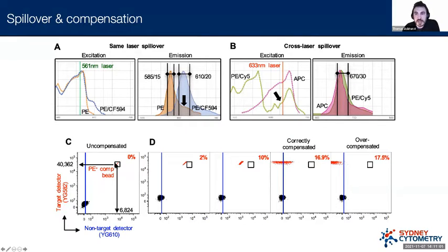Now, the actual math behind how we might correct this is a little bit more complicated than what I'm going to describe here, but fundamentally, in terms of the user input, we can say: what percentage is this spilling over, relative to how strong it is in its primary detector, and then we can correct the signal by that factor. So if we assume it's at around 40,000 here in its primary detector, and it's at around 6,000, almost 7,000 here, this is going to be a ratio of about 16% or about 17%. In this case, we'd call this a compensation value.